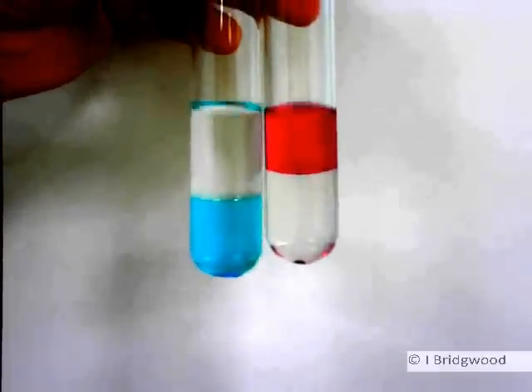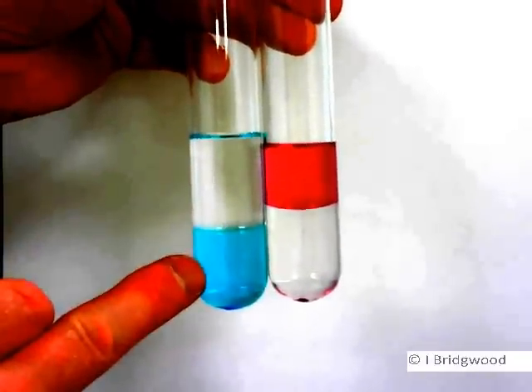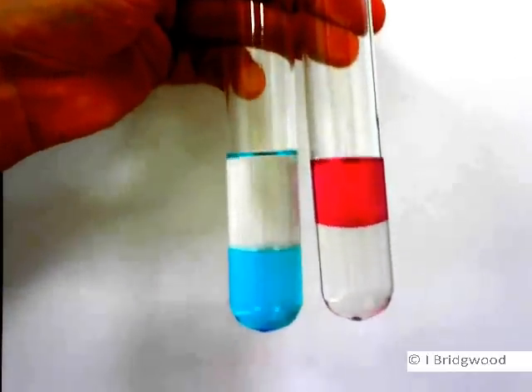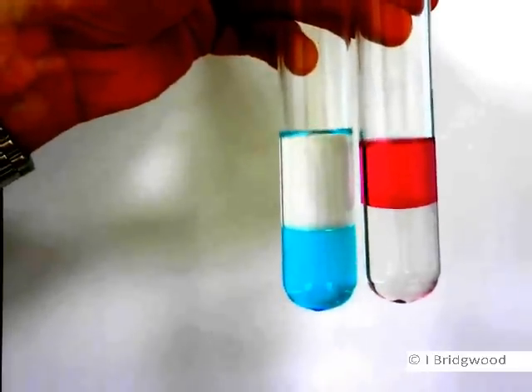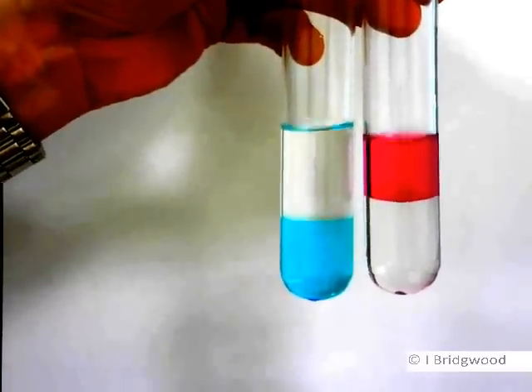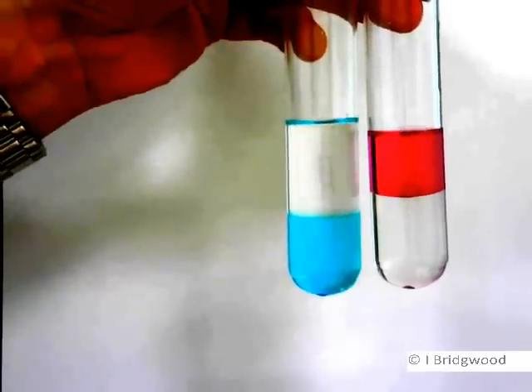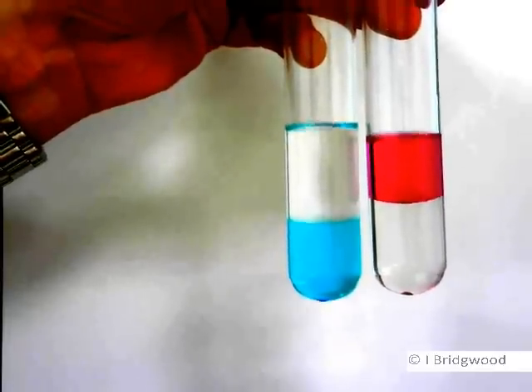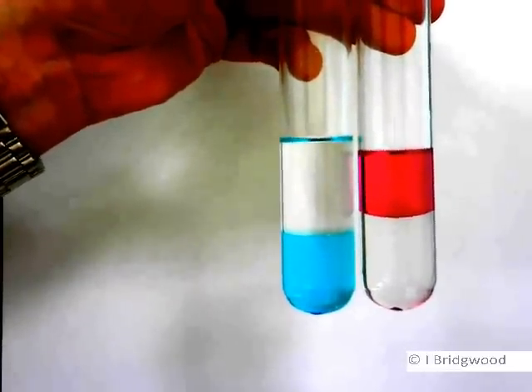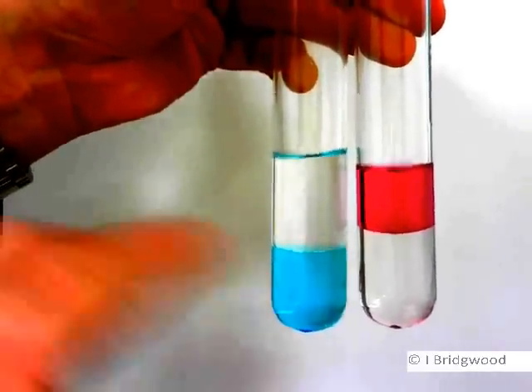Here we can compare two solutions, both containing water and hexane — hexane is the upper layer, water is the lower layer. In this particular tube we have copper sulfate, an ionic compound, dissolving in water. The interactions between the ions and the water molecules are strong enough to overcome the breaking of the hydrogen bonds between water molecules and the breaking of the lattice structure of copper sulfate. We have the endothermic processes of bond breaking between water molecules and the copper and sulfate ions in the lattice, and this is overcome by the bond forming between the water molecules and the copper ions and sulfate ions. That's the major factor enabling copper sulfate to dissolve.